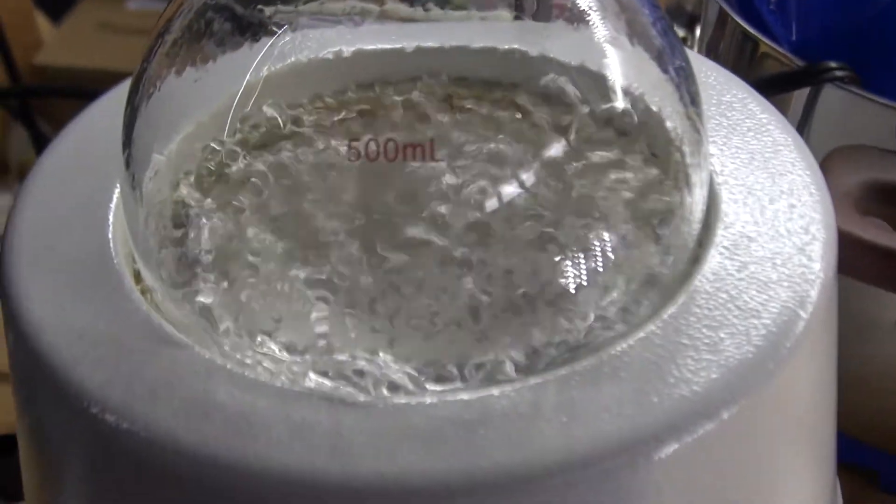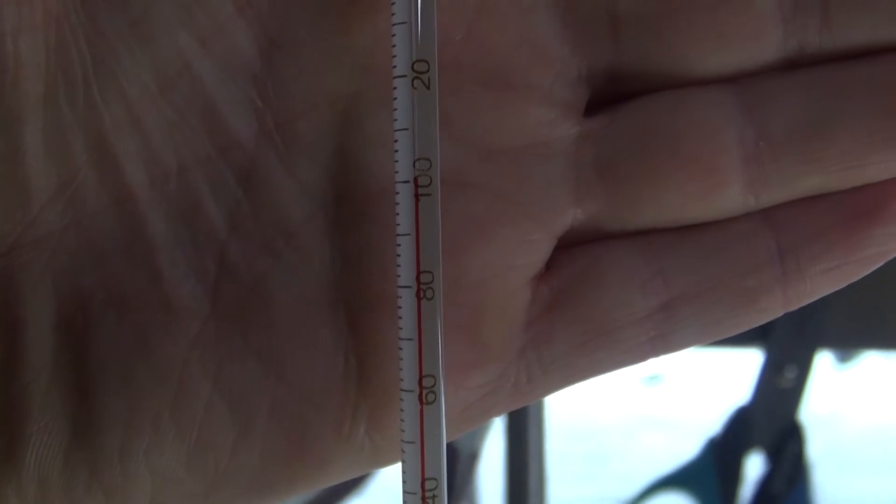20 minutes later I have some boiling water. Now let's see what the temperature looks like. And as you can see, it's 100 degrees Celsius, which means now I'm collecting steam.